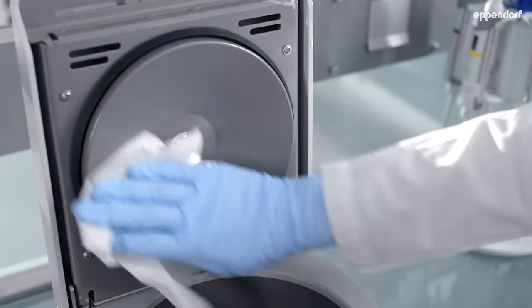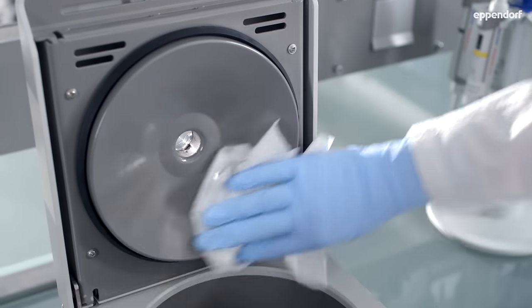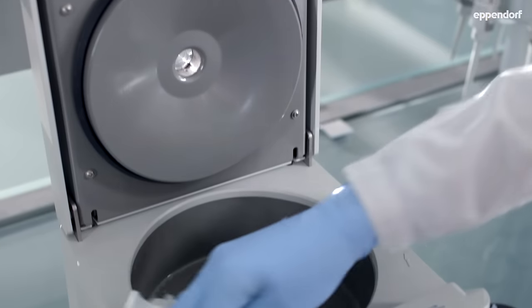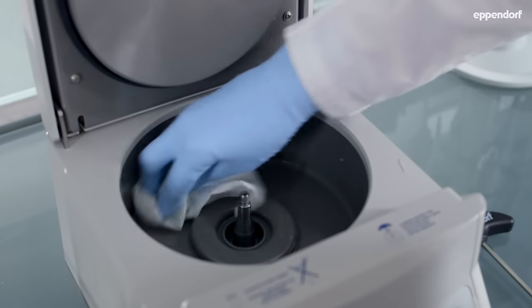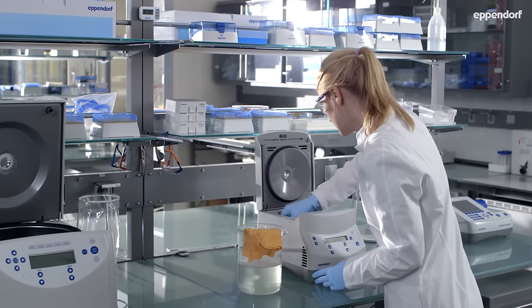In particular, if salt incrustations or contamination with other aggressive chemicals are detected, any residue should be wiped off to extend the life of your device.